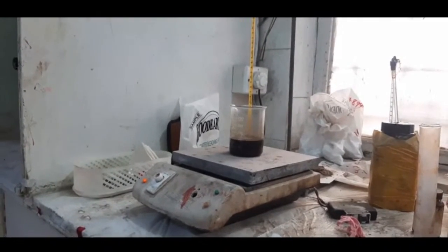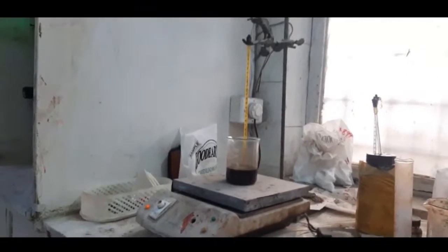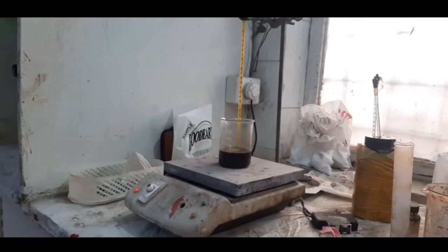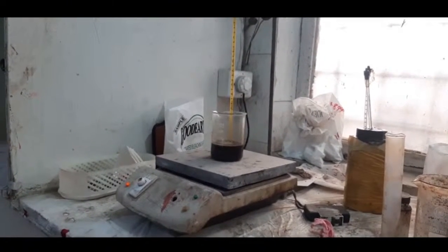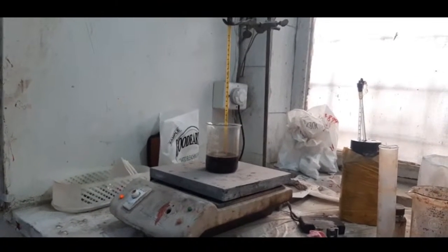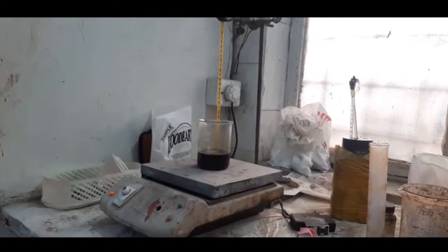Then we put this on the hot plate and heat it till 220 degrees Celsius temperature. Then we will cool it down to 180 and filter it, then compare the result with the previous one.